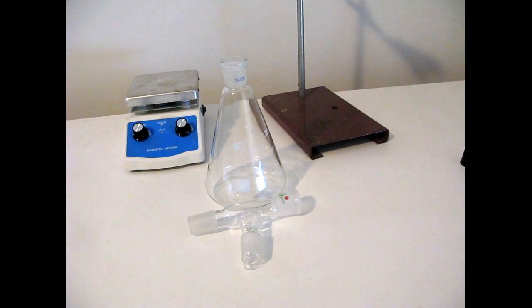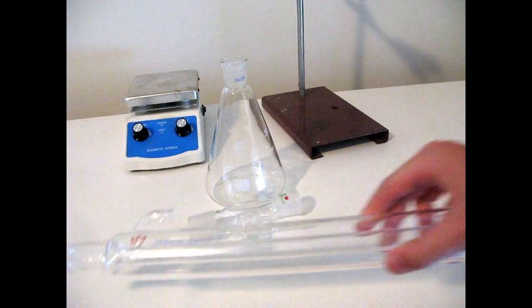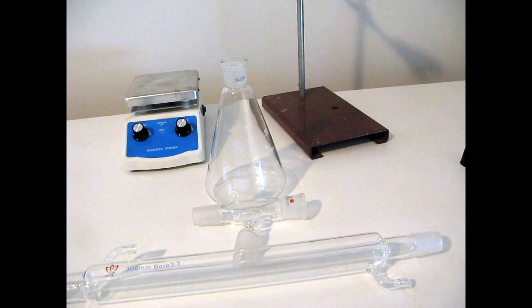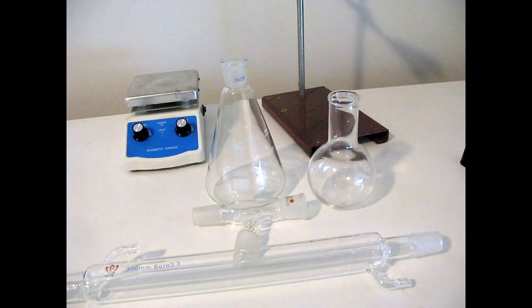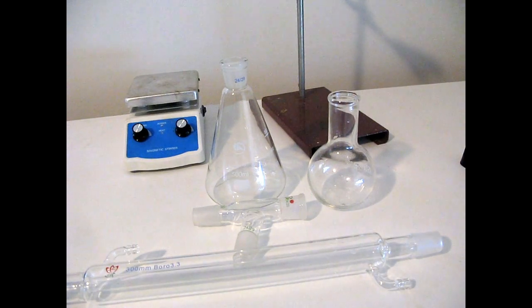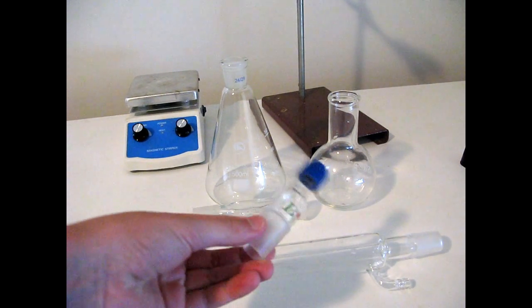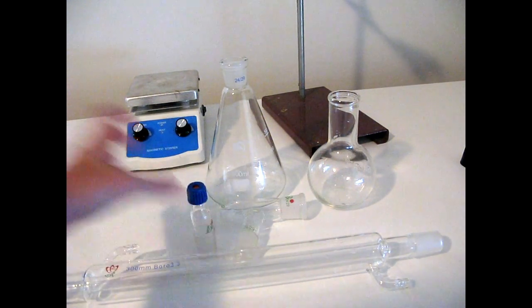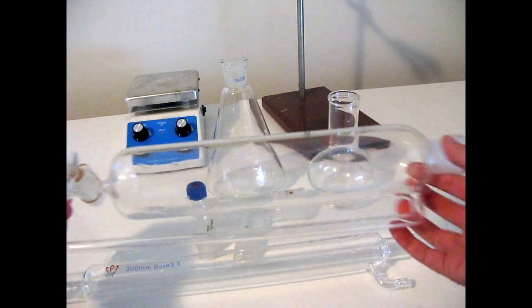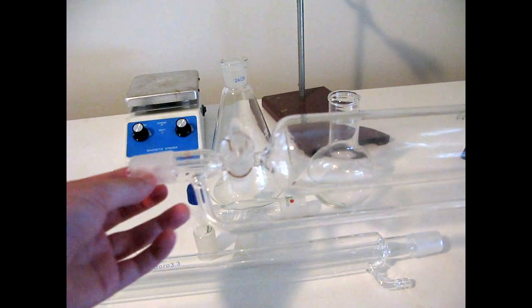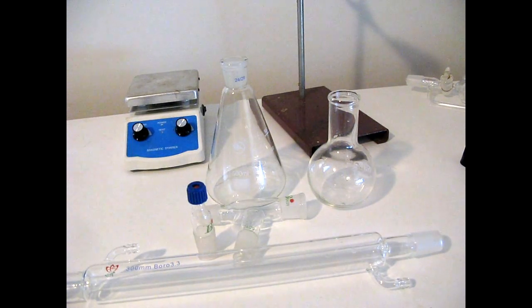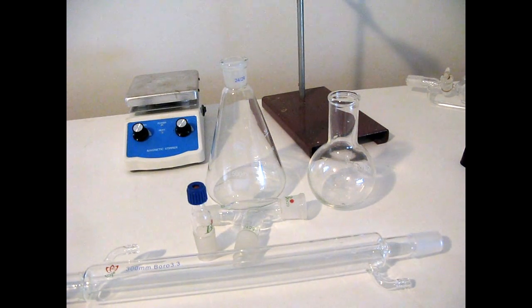You'll also need a condenser, which I have here, a receiving flask. Also, you'll probably need a thermometer adapter. And if you want, you can have an addition funnel or a separatory funnel. Here I'll show how to set up with the thermometer adapter.